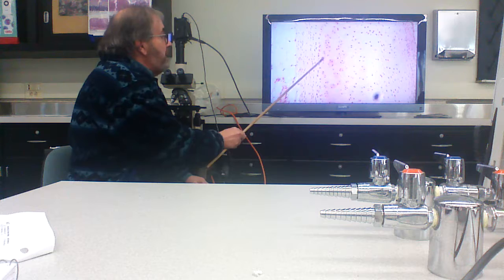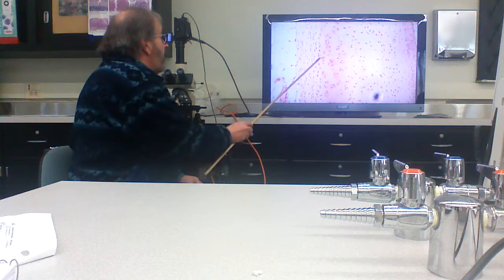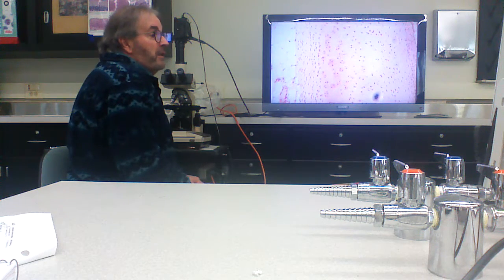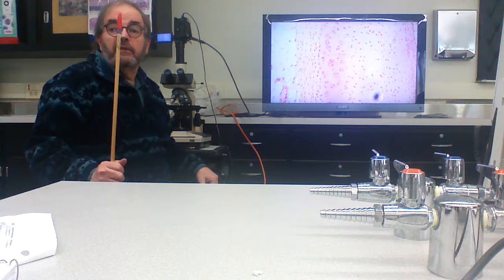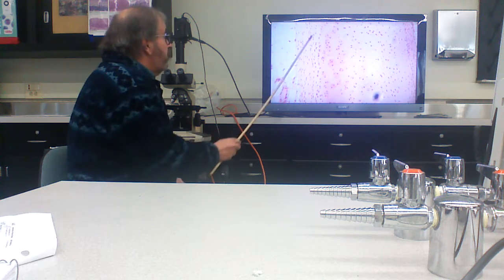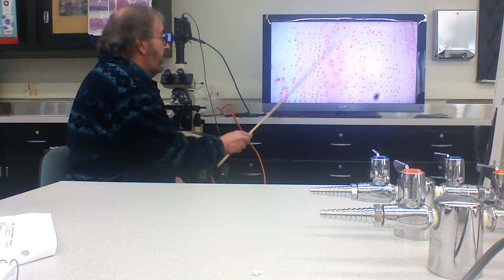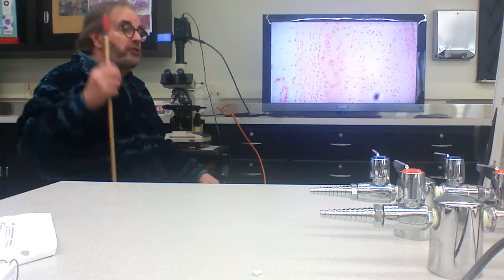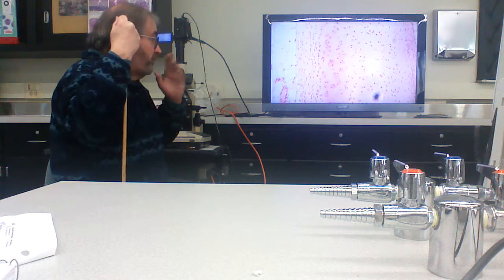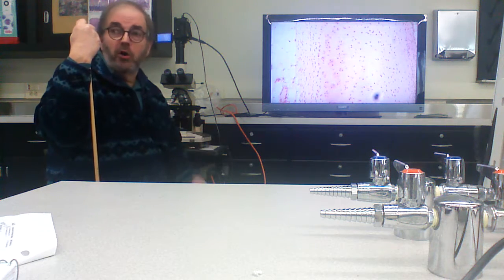But they keep secreting until they die. And they start to divide, but they can't leave the lacuna. So they start to divide, and you start to see multiple cells and multiple nuclei inside of the lacuna. These are sometimes referred to as cell nests. And it's about the only place you're going to see these. You see a cell nest, you know it's some kind of cartilage.